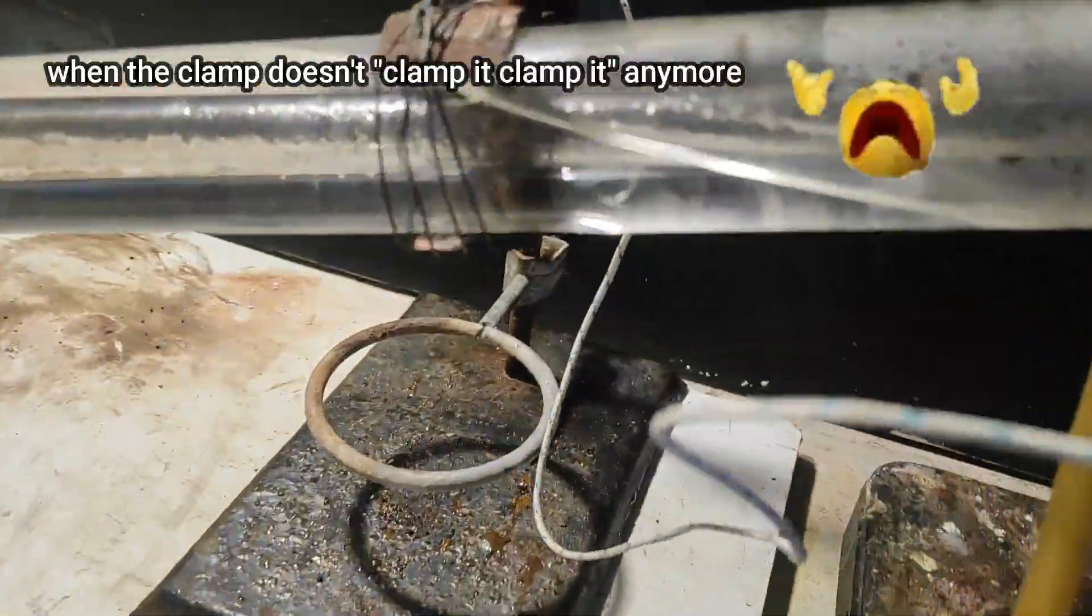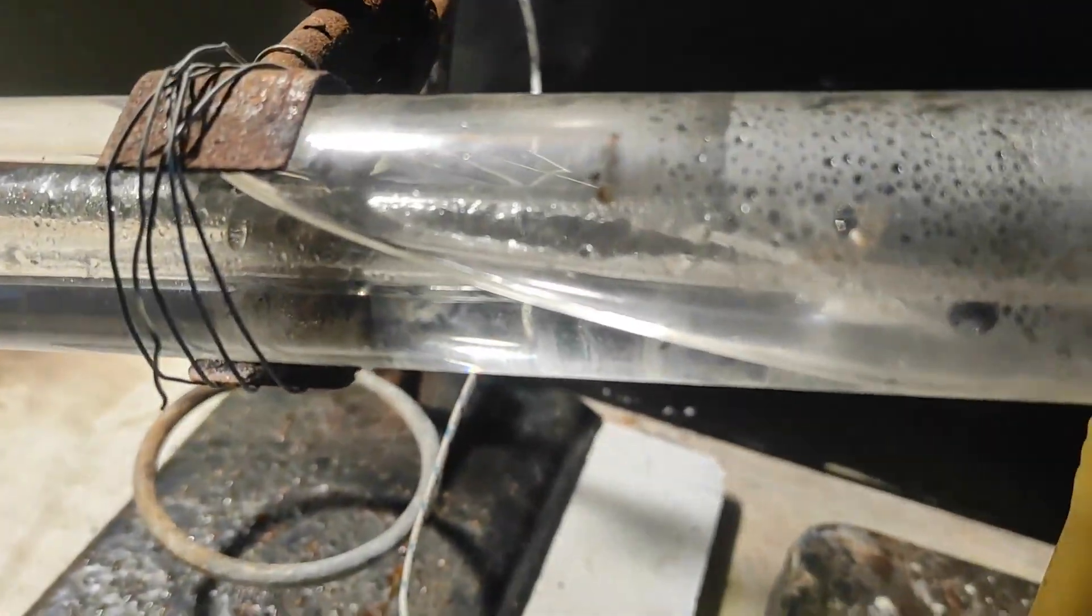I had to attach the condenser with some iron wire, because my clamp doesn't want to close correctly anymore. One day, I'll try to make my own stands as well.